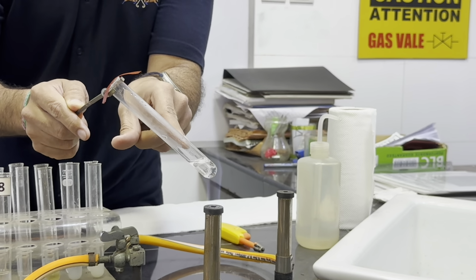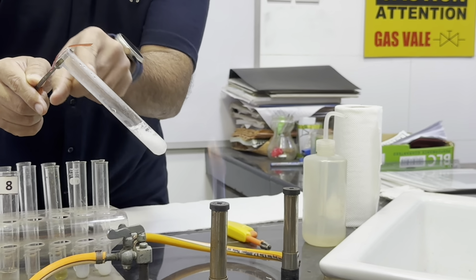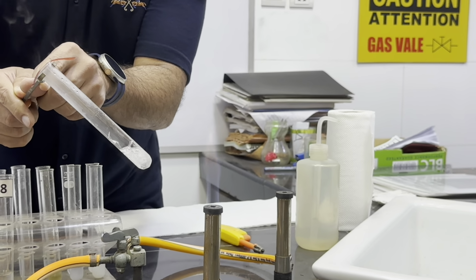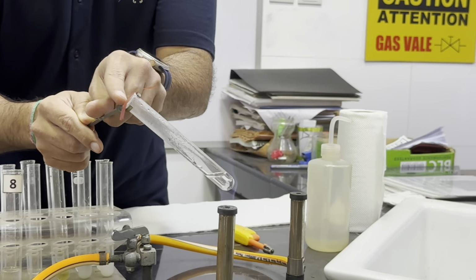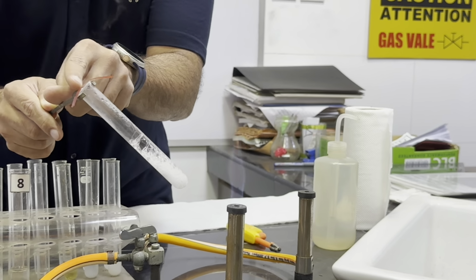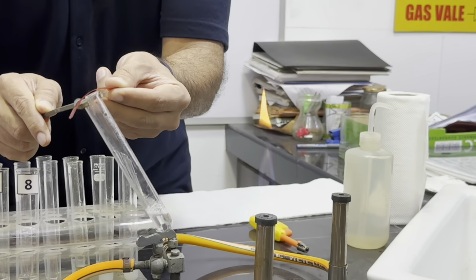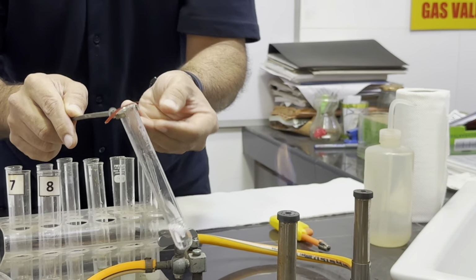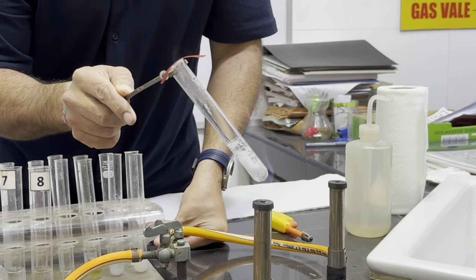Now the gas, we can see, is liberating slowly. We do not heat this so much that the solution comes at the top. No, we will remove heating. So if we heat and the solution comes up, we will remove that, right? Now we will observe from the top that the solution is turning into a gas, that is ammonia. The litmus paper must turn blue. So from here we can see the solution is liberating a gas that is slowly turning this litmus paper blue. Let's heat it further because the blue color is not clearly seen, but it's slowly coming.